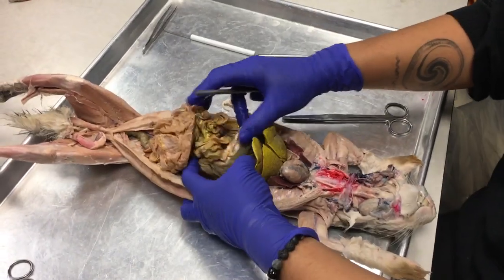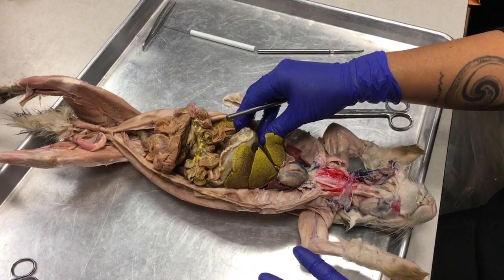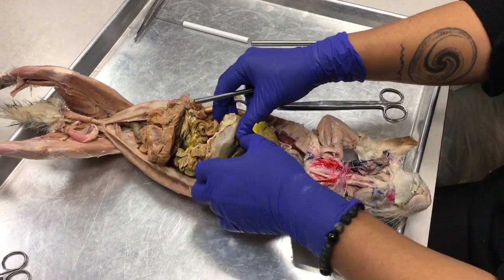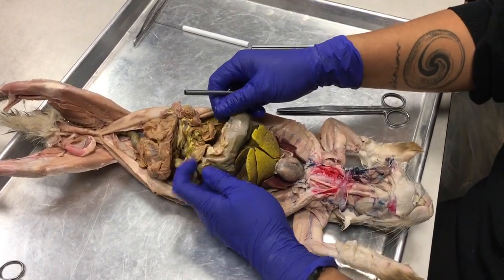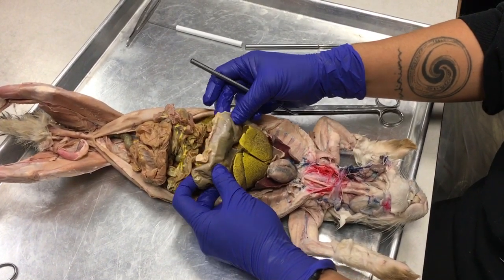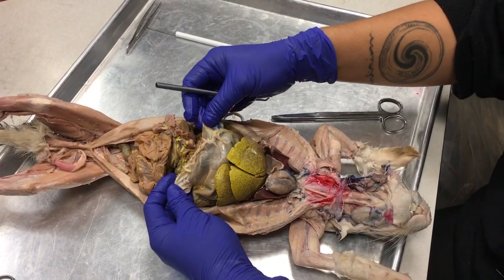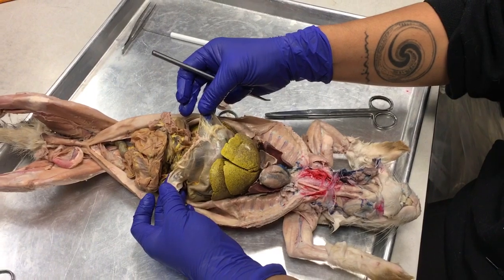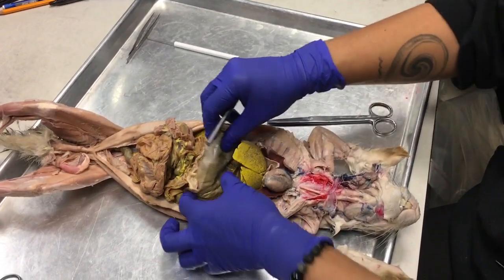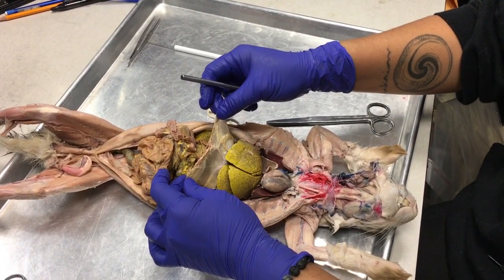Okay. Look at this big stomach. I've never cut into a vegetarian animal before, like one of these, a rabbit, I guess. But if you look, the stomach is this huge pouch, and this poor bunny ate so well before he gave himself to science. And there is a mesentery that is coming off the greater curvature of the stomach. This is the greater omentum, okay?